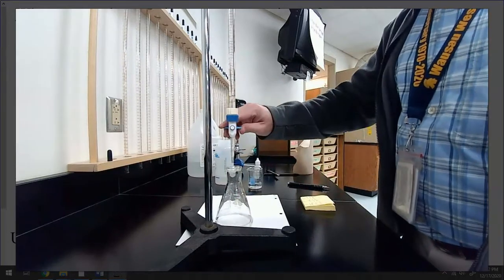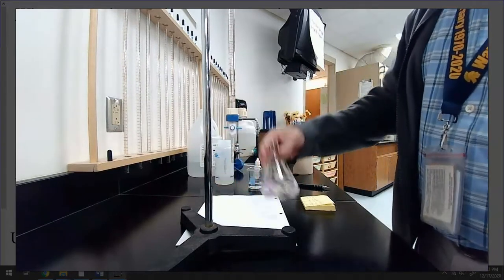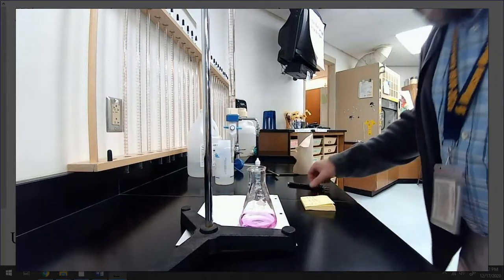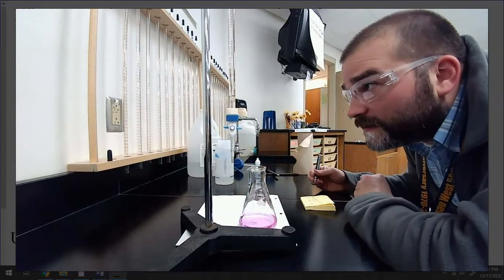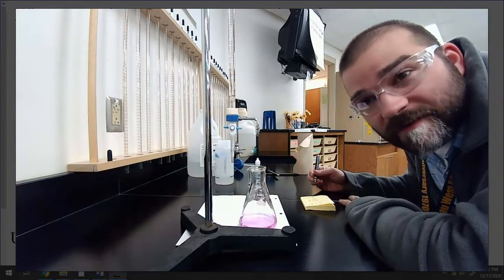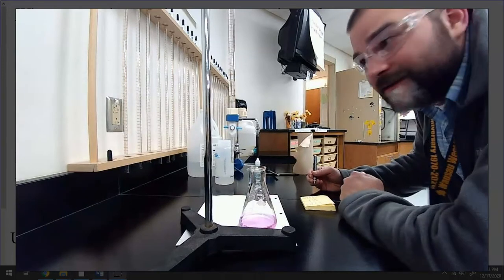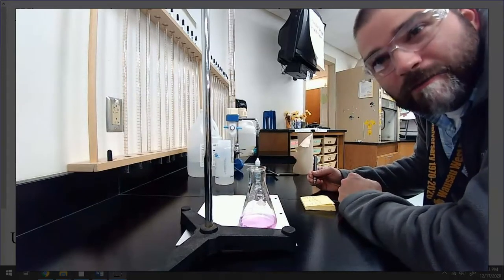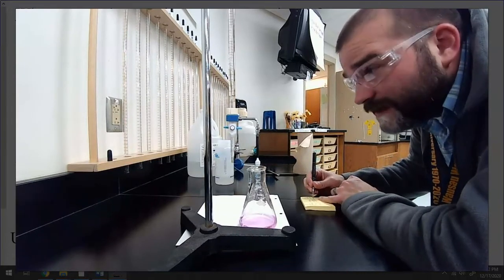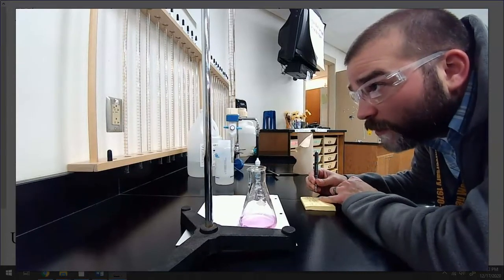Let's get one more little pop in there. Ugh. There. Now it's pink. Okay. So instead of 49.08, how about 49.10? That's all I added. I added 0.02 of a milliliter by that little quick half turn. It's the best method. It works really, really well. So instead of the 49.08, 49.10.